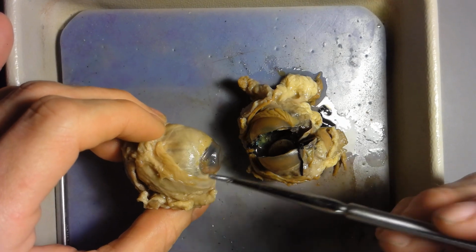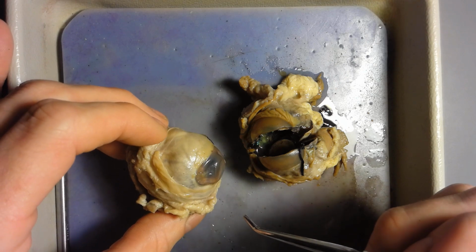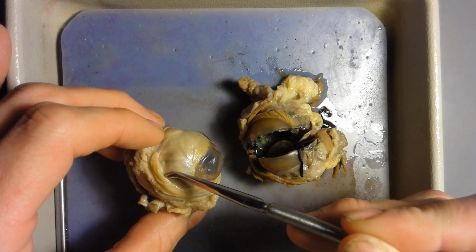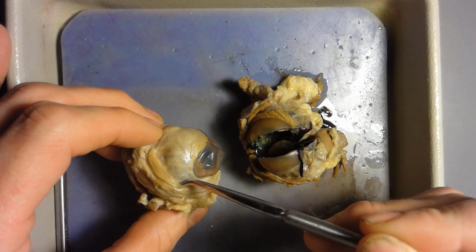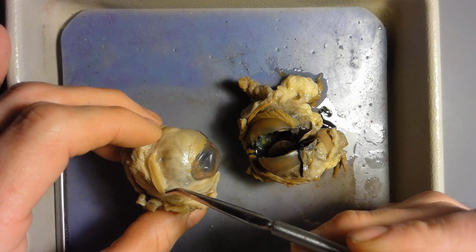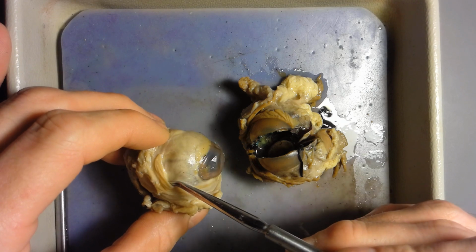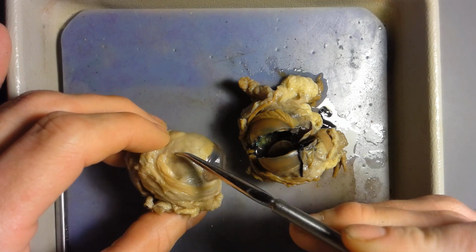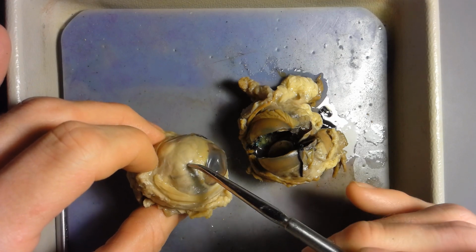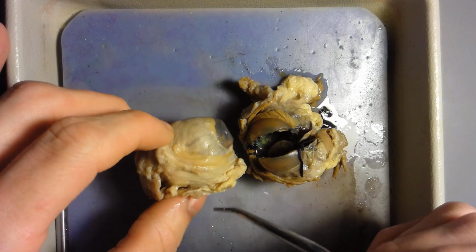So conjunctiva. Where have you heard of conjunctiva? Might be from conjunctivitis. Conjunctivitis is when this tissue right here becomes inflamed, and when it becomes inflamed, it becomes pinkish red. That's what we call conjunctivitis, pink eye. Okay, so conjunctiva right here. It's a flat, clear skin that covers up the whole eyeball. If I scrape away the conjunctiva, I'm going to get to the white of the eye. The white of the eye is the sclera, which we saw on the eye model.